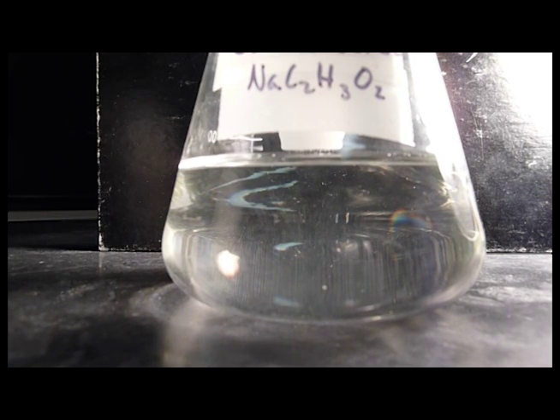All I need to do is agitate the solution enough, and all of the sodium acetate that I have dissolved into this solution will recrystallize very quickly. So let's see if I can get it to go.